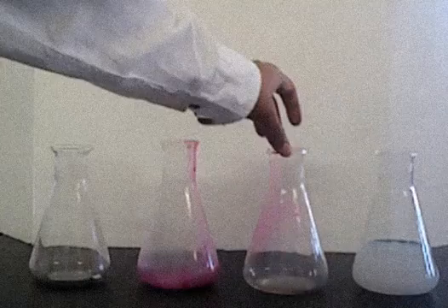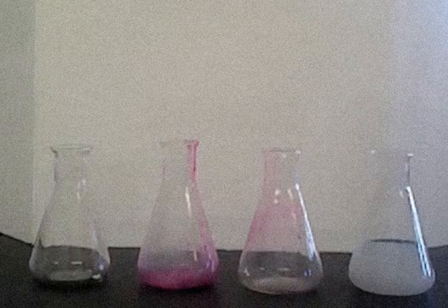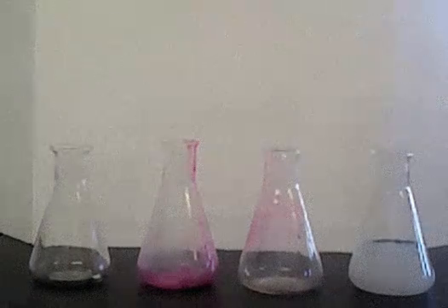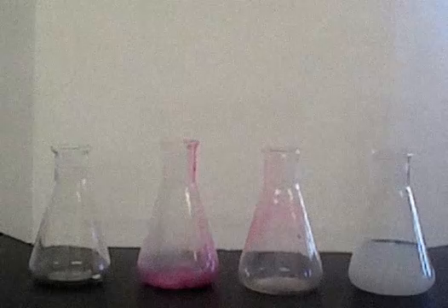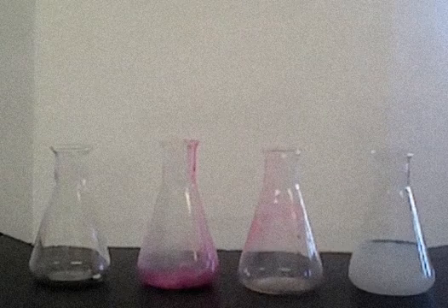And we take the barium carbonate and we throw it into concentrated hydrochloric acid. And then the carbonate reacts with the extra hydrochloric acid to form carbon dioxide bubbles, and we get a clear solution of barium chloride that is left behind.